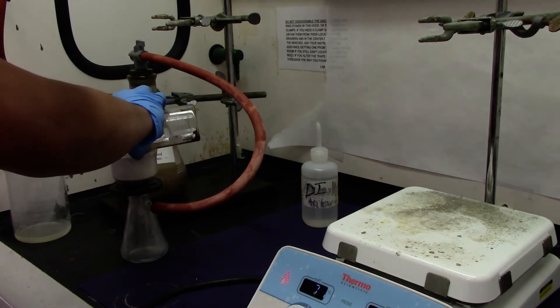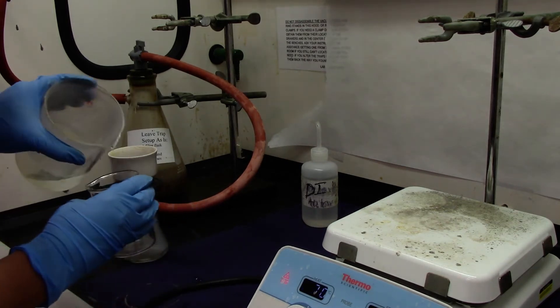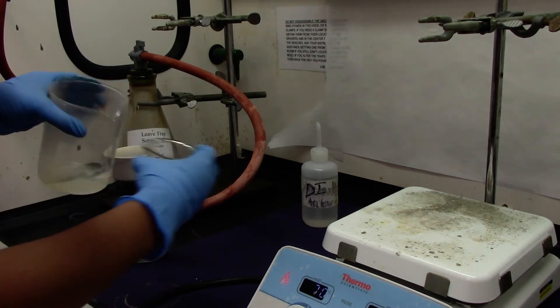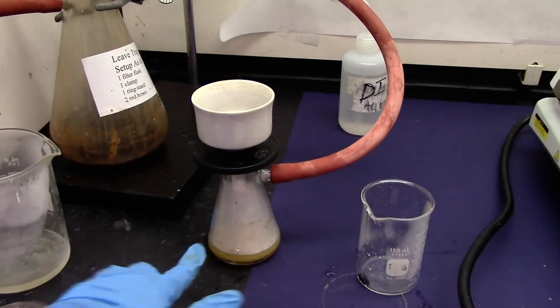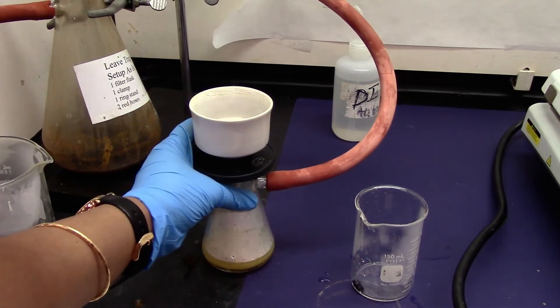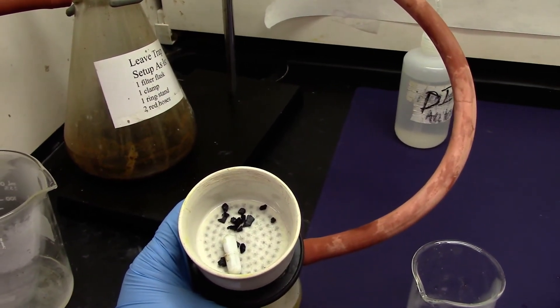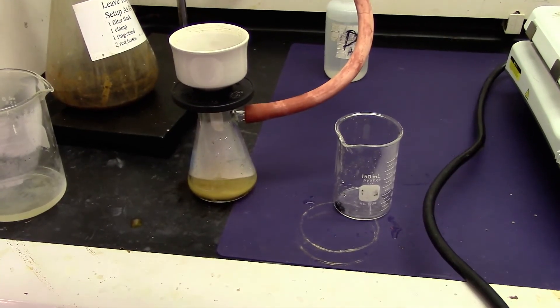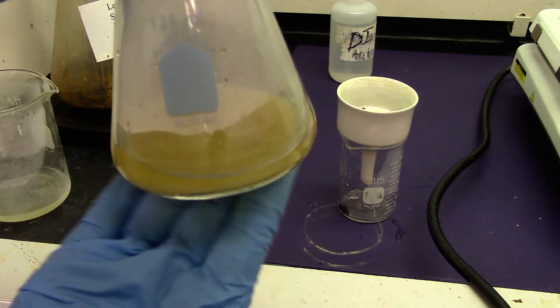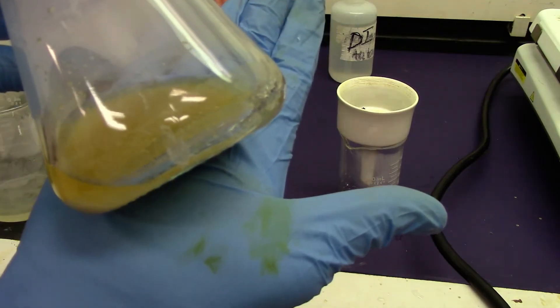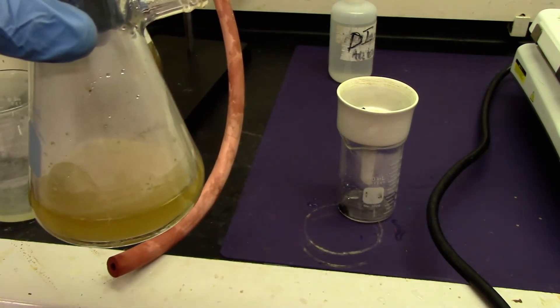And transfer right away. Turn on the vacuum. You can wash this beaker with some hot water. The product solution is down here and the funnel contains the stir bar and the charcoal. As you can see as it cools down, the product crystals have started forming. These are yellow crystals forming. I will let it cool down for a few more minutes before you can filter it out.